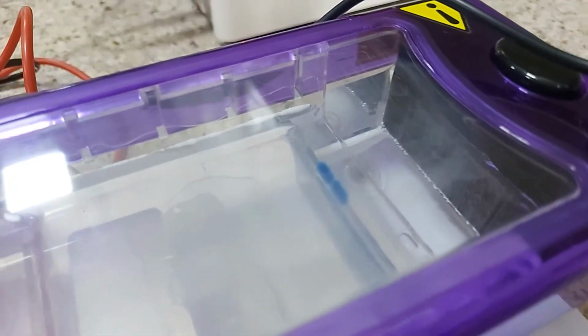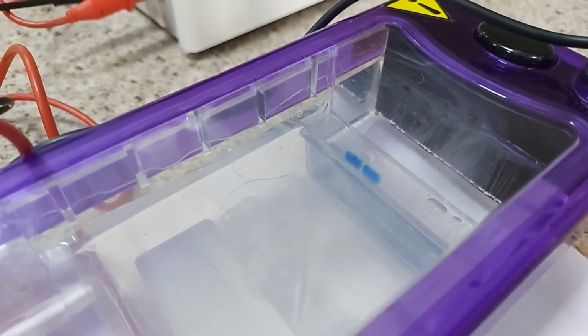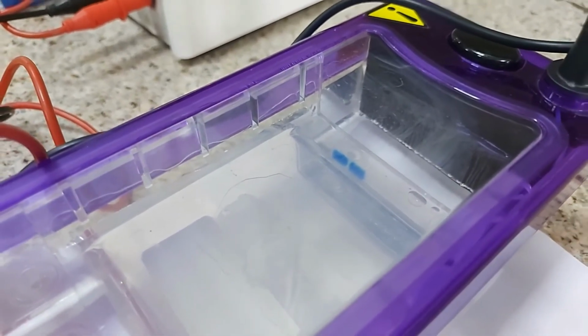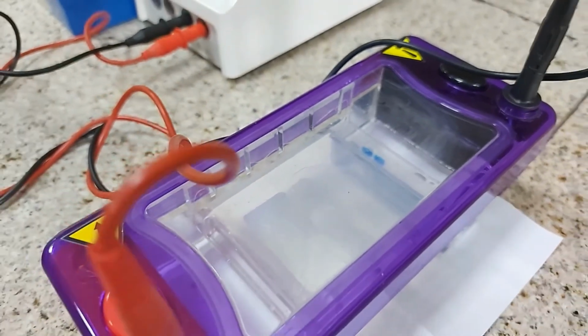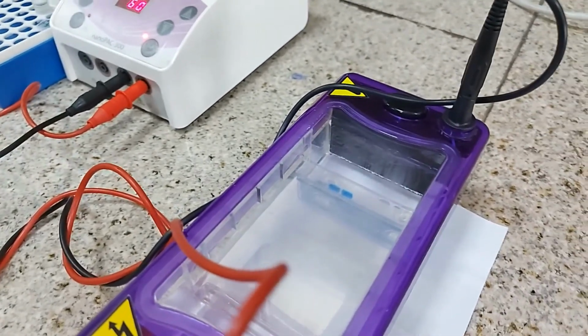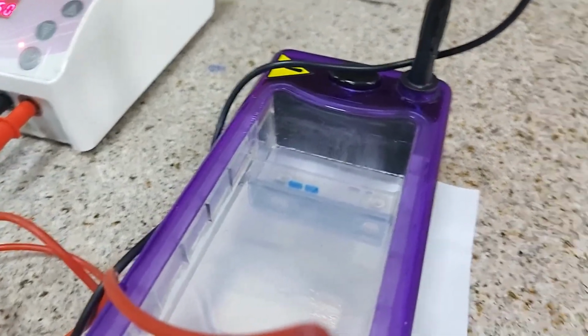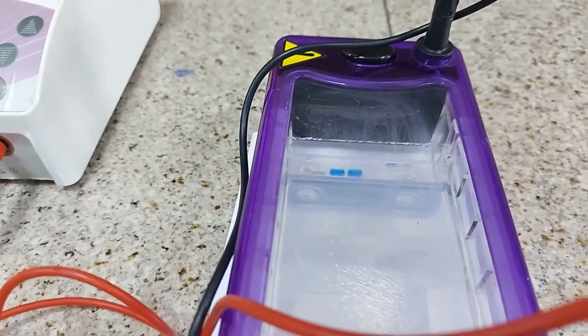very slowly into the system, and this will run for about 30 to 45 minutes, and we will leave it like this till that time, and we will come back. Obviously we will not see the top as clear as we are seeing it now.